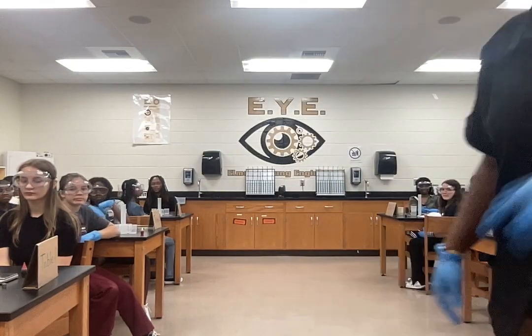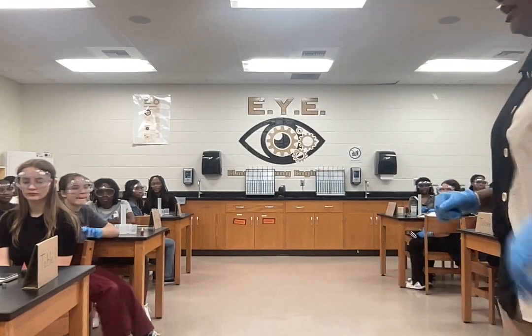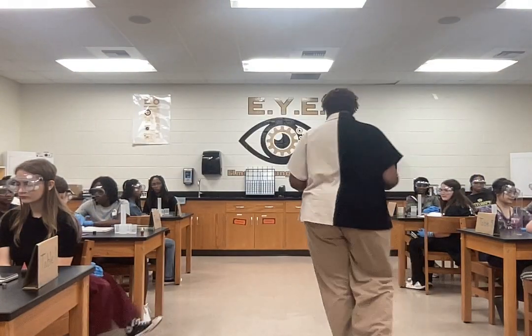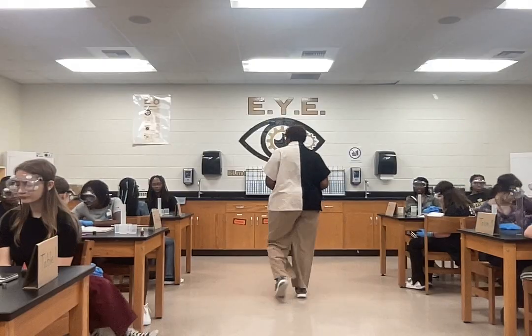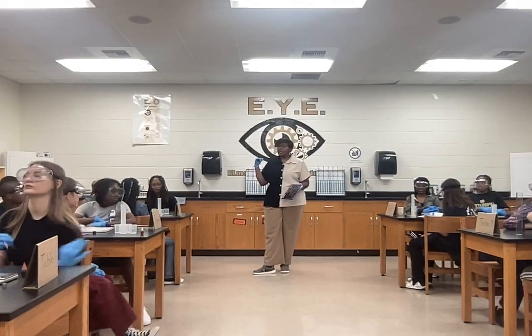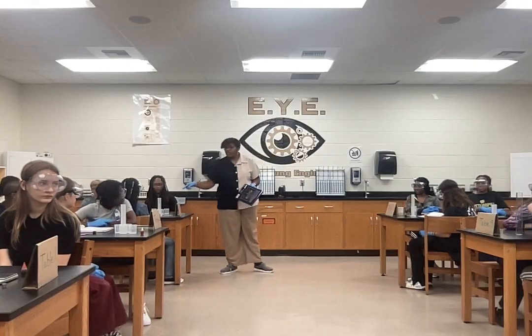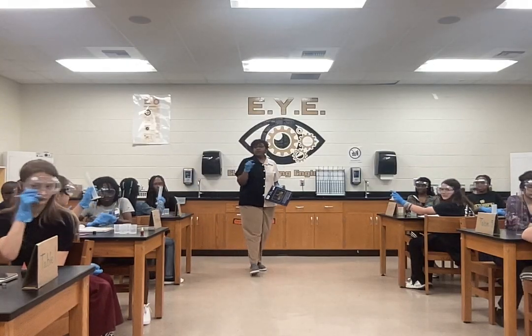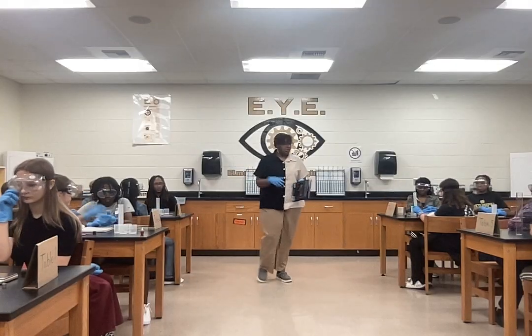So, guys, if you turn in your books on your table to page 42, you should see investigation 3.1. We're going to start by looking at the mass, volume, and density of various liquids. Now, we're really just looking at water, so I'll let you come one at a time to fill up the graduated cylinder. Can someone hold up the graduated cylinder? We're going to fill this up with 25 milliliters of water, okay?